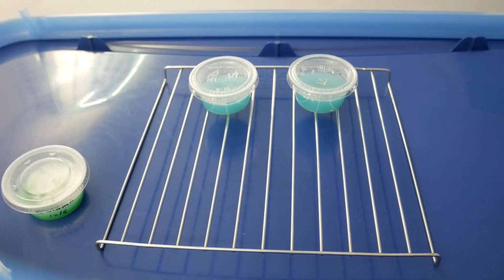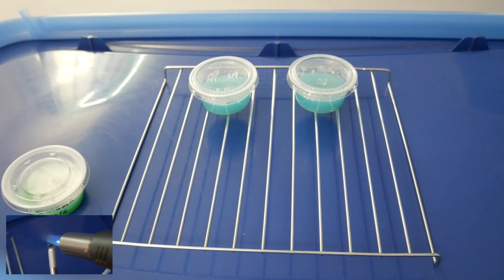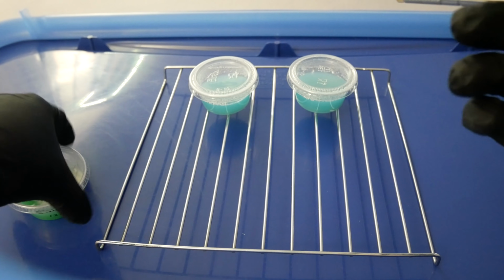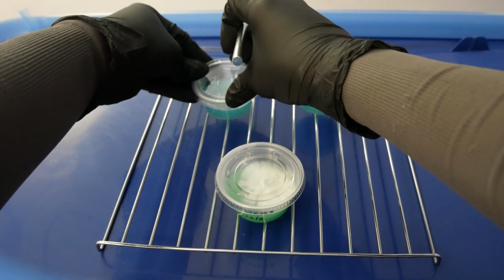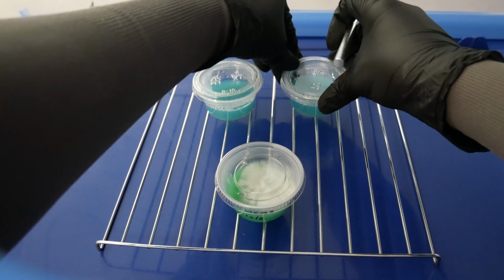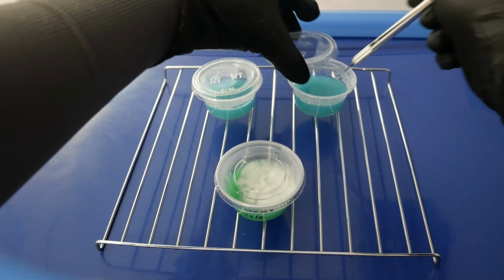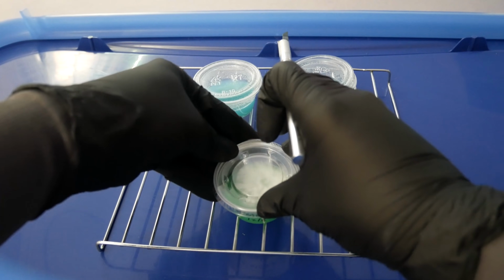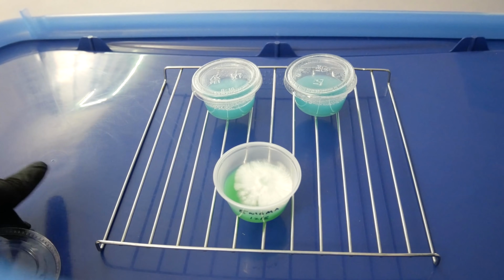Here, put your clean plates on top and then have the dishes that you're working with below it. That way you're making transfers towards the clean and you don't have to overlap your hands over the clean plates and risk any contamination falling into it. It's all part of sterile technique. Alright. Go ahead and pre-open the lids here, and I'll cool my blade in the clean plate of agar. That way we don't have to wait for the blade to cool, and we can start working on our dish.